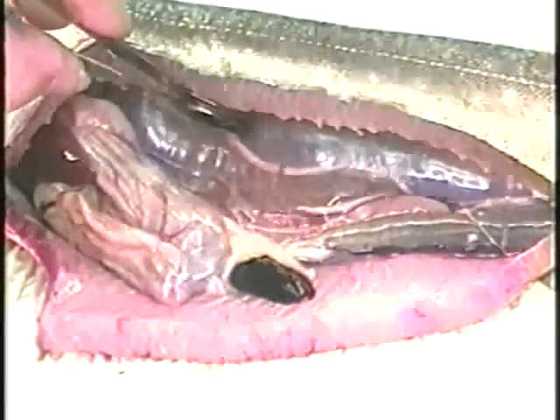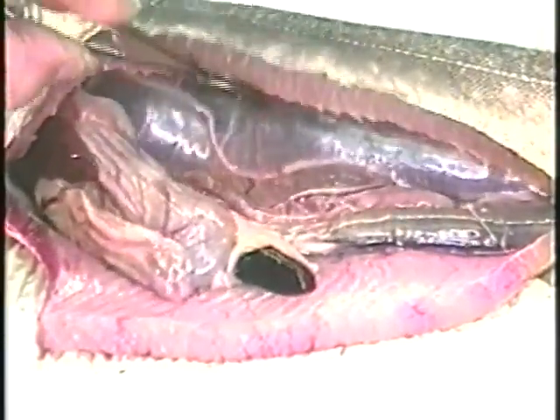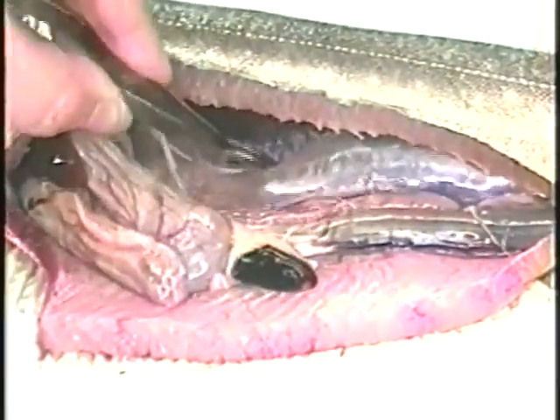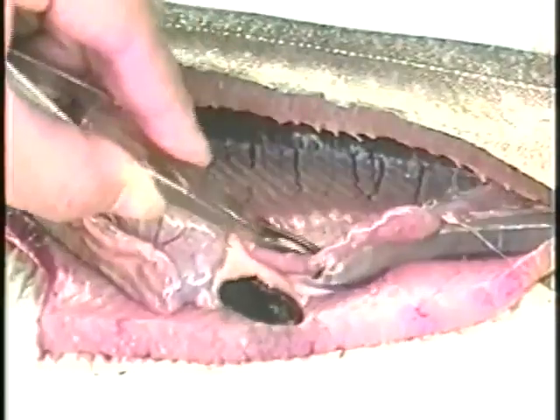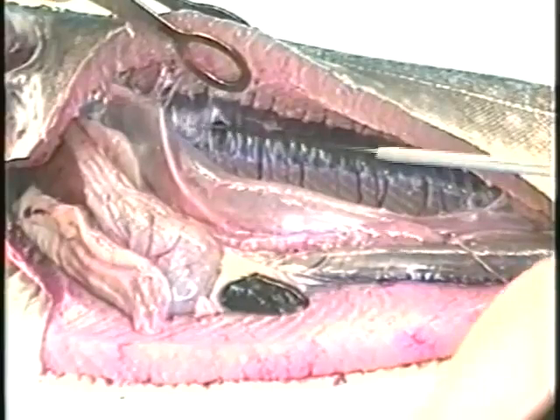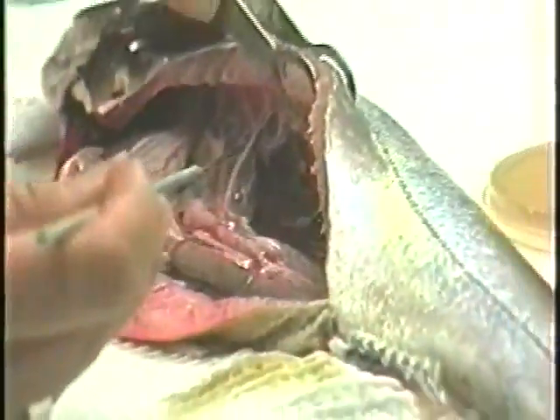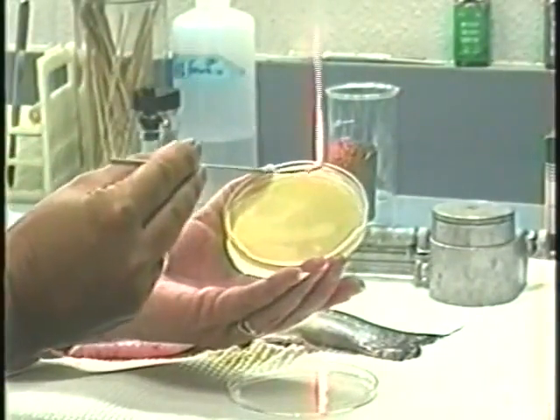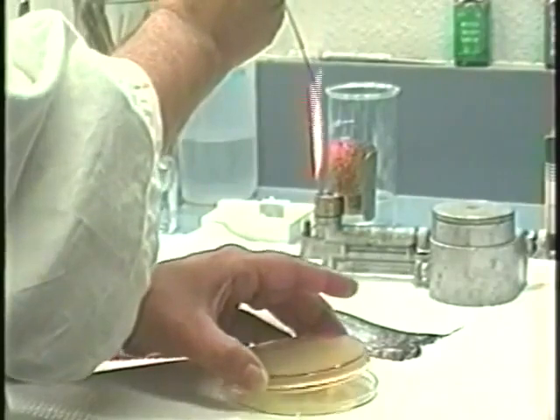To sample the kidney, either cut out or pull the intestinal tissues away from the swim bladder, then gently strip the swim bladder from the kidney surface. To inoculate a sample onto bacteriological media, flame a metal loop until red hot, then insert it into the anterior part of the kidney. The sample is immediately inoculated onto a plate of sterile agar by streaking back and forth across the surface of the agar at one end of the plate. This is termed the primary inoculum.